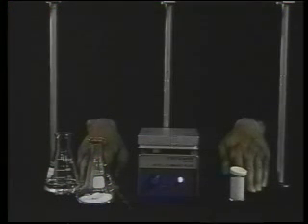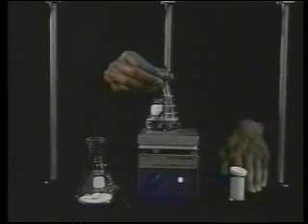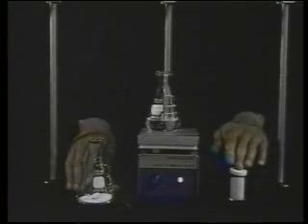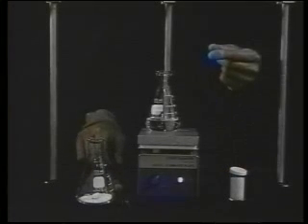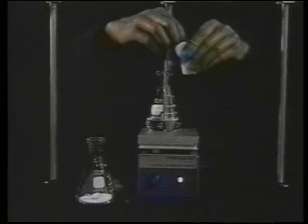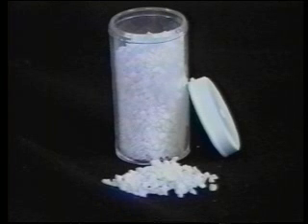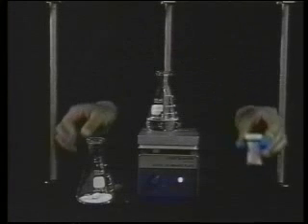In the second step of this technique, you dissolve the solid sample in the suitable solvent. You will need an Erlenmeyer flask for the solvent and another to hold the crystals, a hot plate, some boiling stones, a Dispo pipette and bulb, and finger cots. Add two boiling stones to each flask. This is important because boiling stones contain air-filled pores which serve as sites for bubble formation, preventing a heated solvent or solution from bumping and leading to smooth boiling.